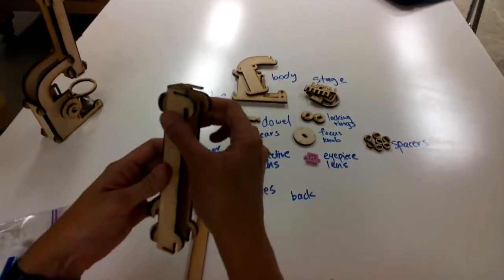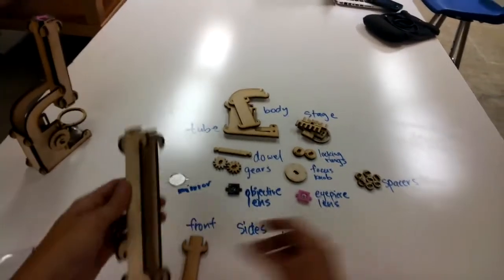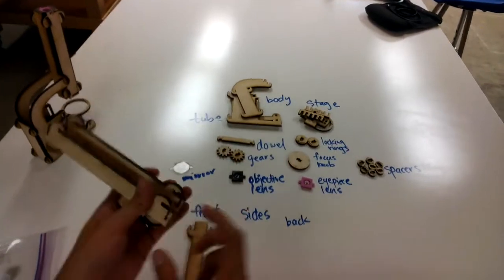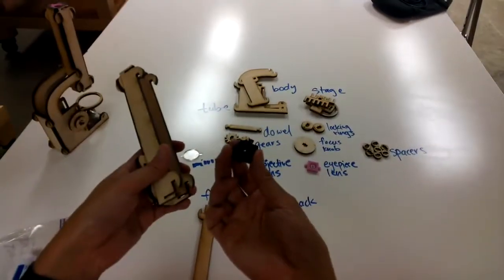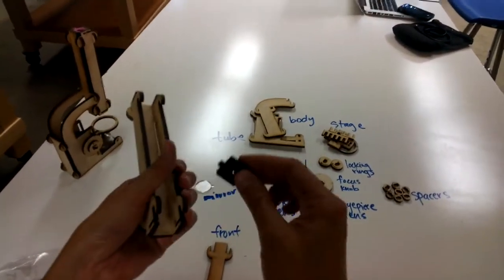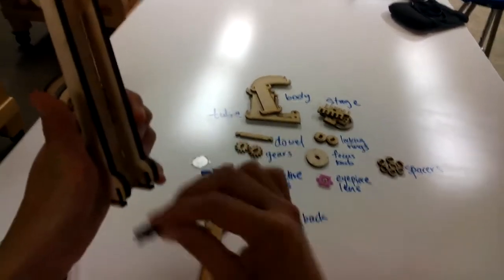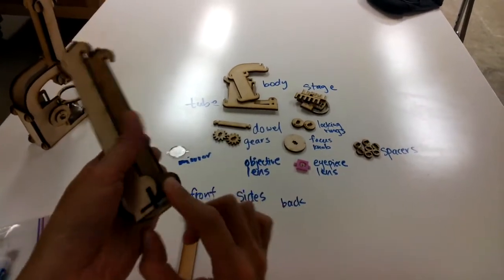So now we've got this little tube with open slots here. Before we put on the last piece of the tube, we're going to add on the lenses. On the bottom part of your tube, that's where the objective lens goes. The objective lens, again, is the lens that has one big hole on one side and a tiny hole on the other side. So we want the side with the tiny hole to be on the bottom, facing out of the tube. So you slot that into this little slot and it should just fit.